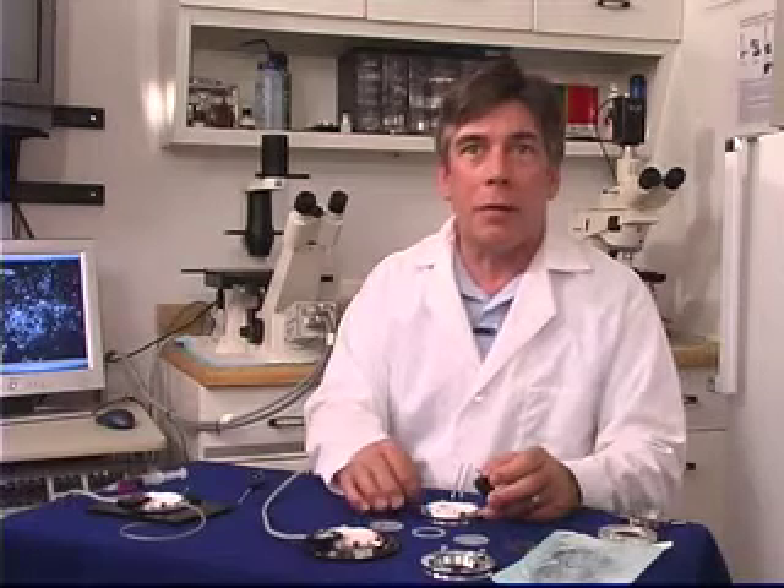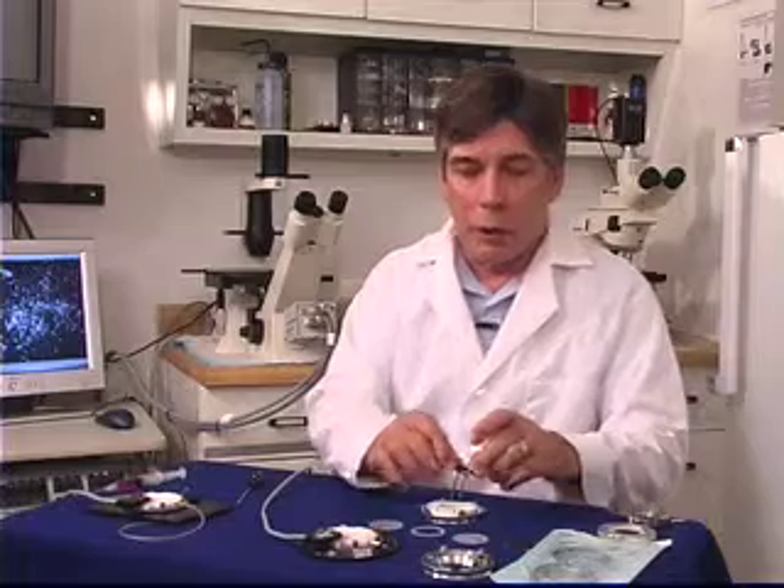To further accentuate temperature exchange above the microaqueduct slide for more uniform temperature control across the field, there is an additional perfusion port that goes in the top of the FCS-2. You simply lay this on top of the chamber and press it in place. It is O-ring sealed and allows you to perfuse your own refrigerant or heated fluid over the top of the microaqueduct slide.